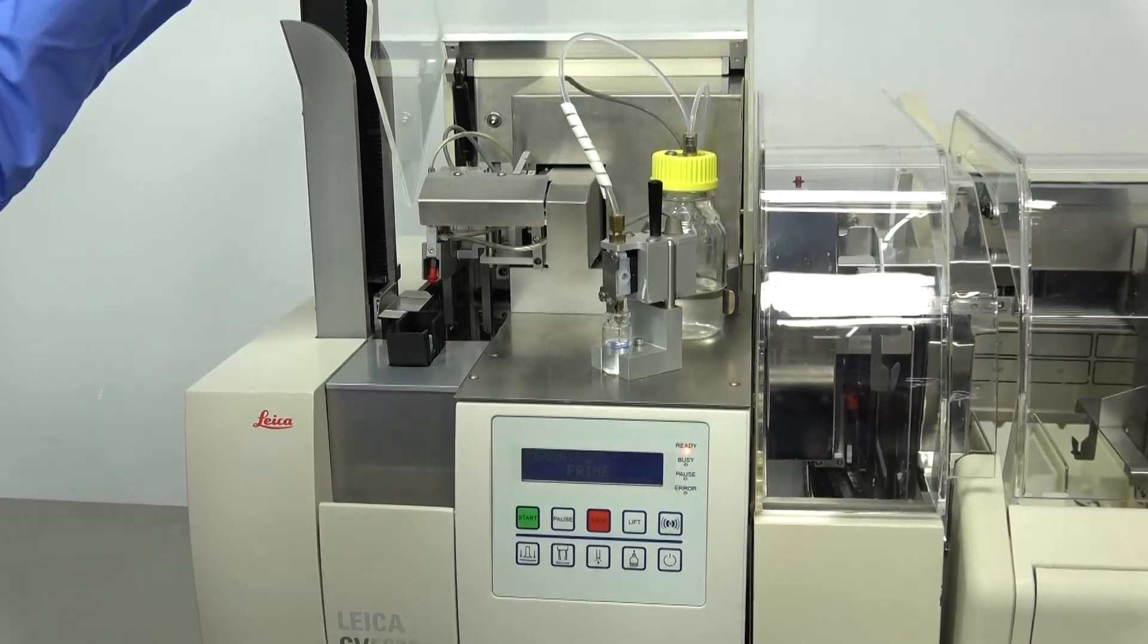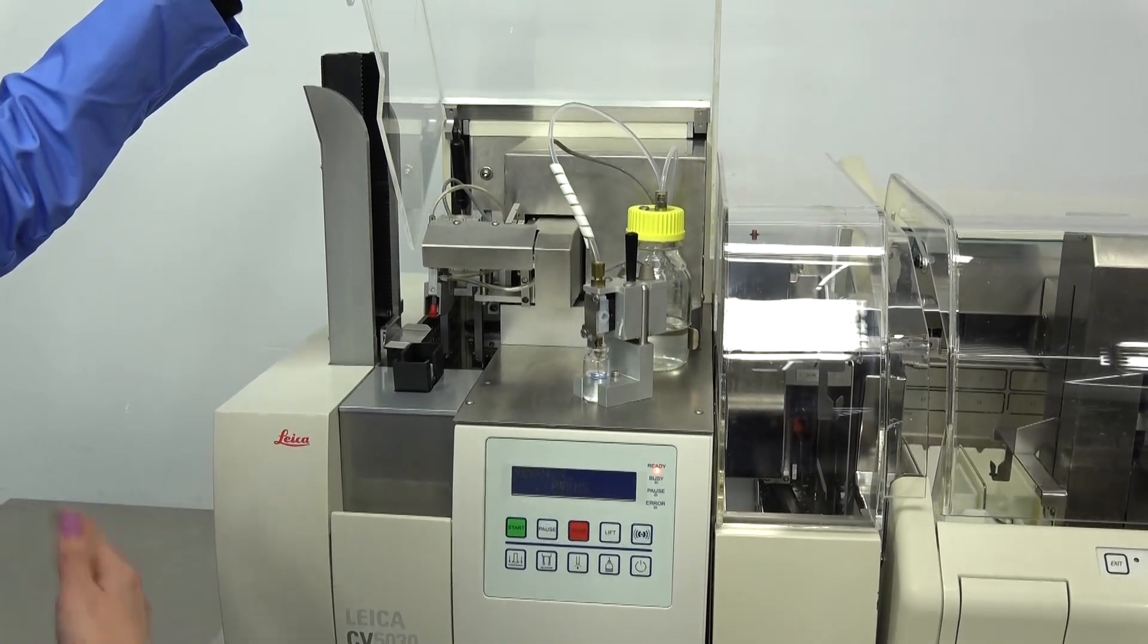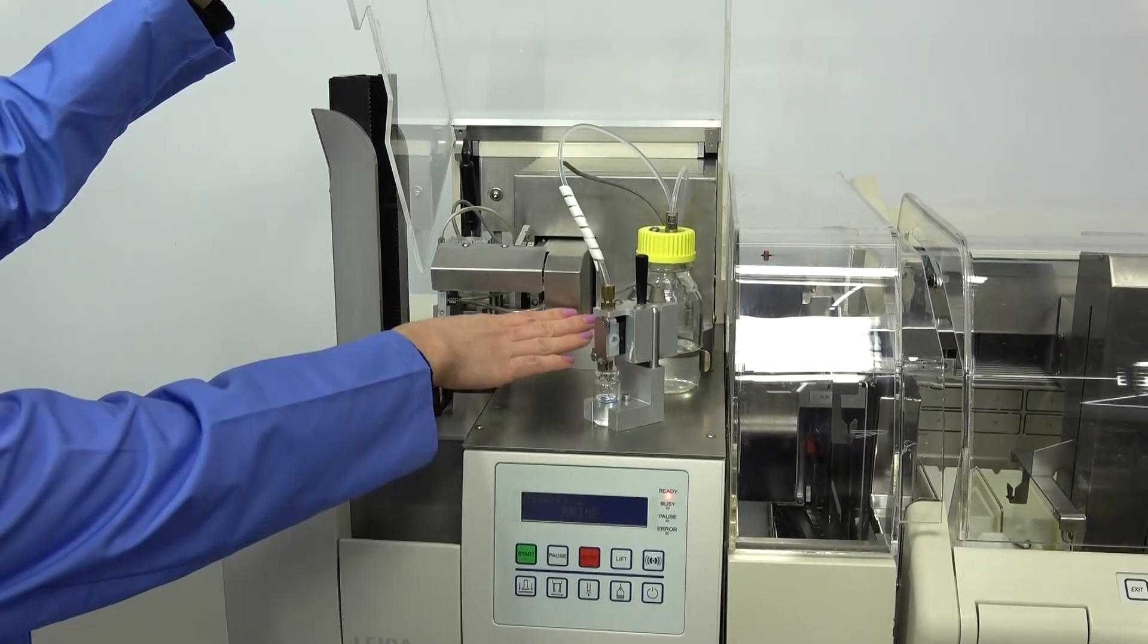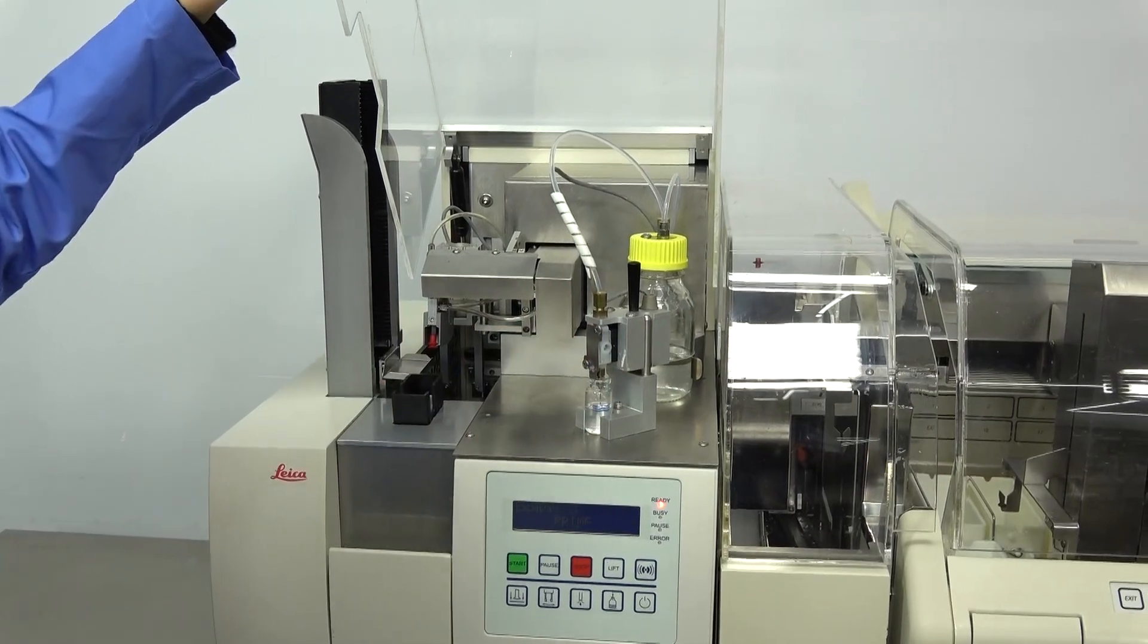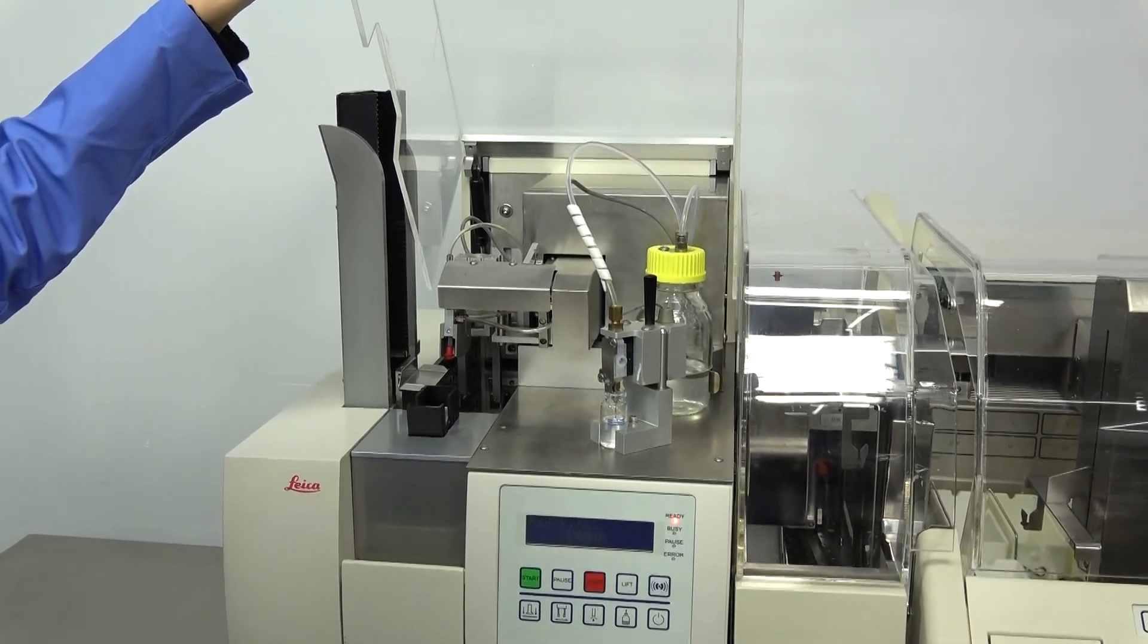Now what it's going to do is it's purging the line and getting rid of all of the air bubbles while creating a vacuum chamber here within the reagent container, and that's going to hold your liquid glass.